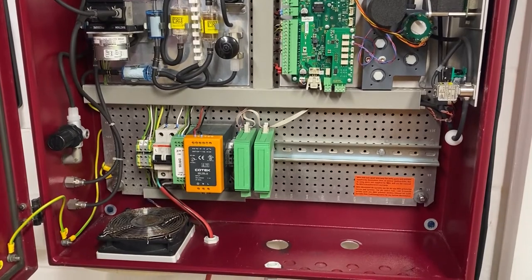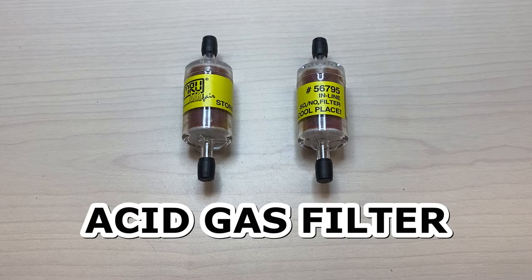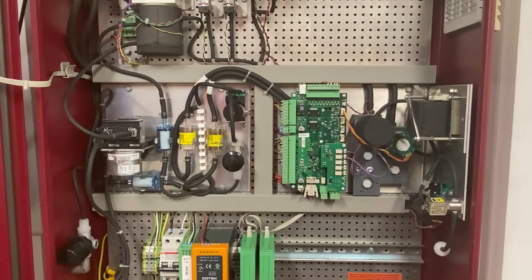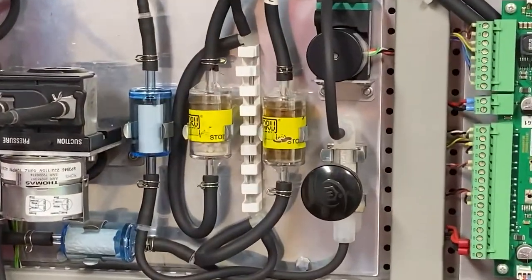In this video, we'll be going over replacement of the acid gas filters. You can find both filters just slightly left of center inside the SWG-100.